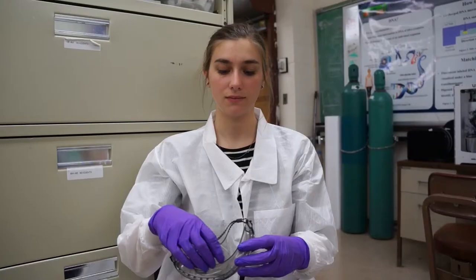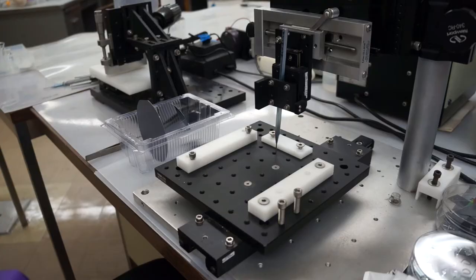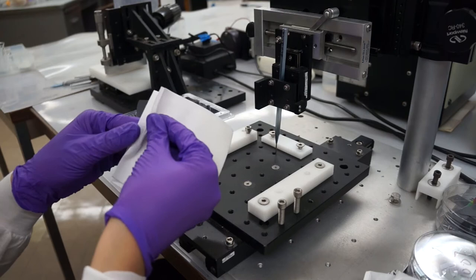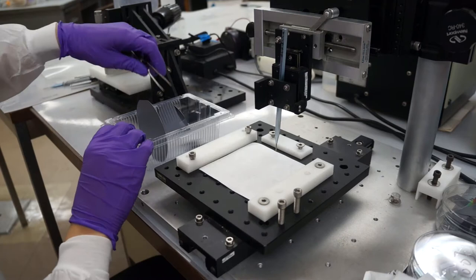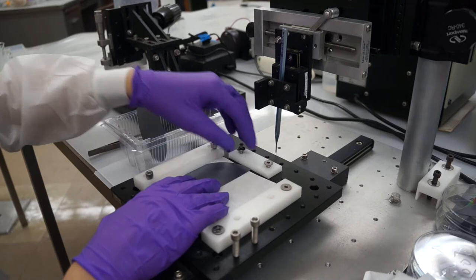Silicon shards can be very painful if they get in your eyes, so you should use goggles for this part. The samples we're aiming for are about 1 to 1.5 centimeters squared squares. We use this scribing setup to make cutting the large pieces evenly a bit easier. Secure the wafer, shiny side down, on a piece of clean room wipe onto the stage by placing its top and left edges partially under the Teflon pieces that are screwed to the platform.